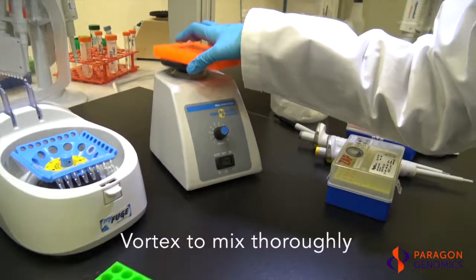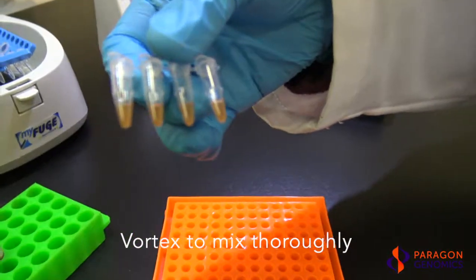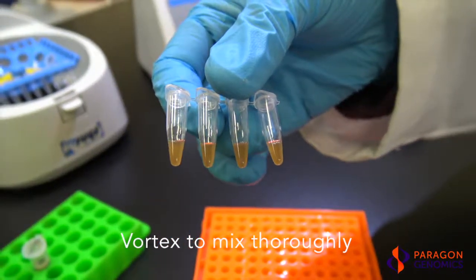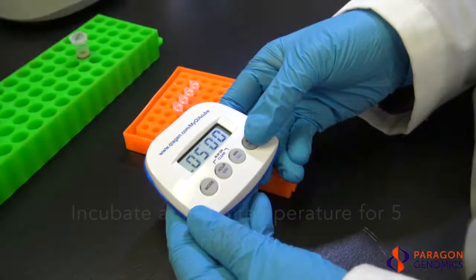Mix the solution thoroughly by vortexing or pipette mixing. Make sure there is no gradient present in the solution. Incubate the samples at room temperature for 5 minutes.